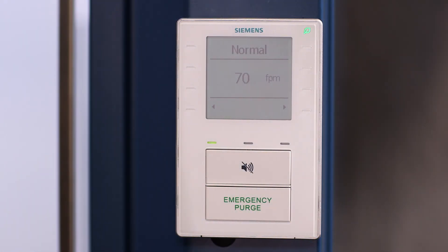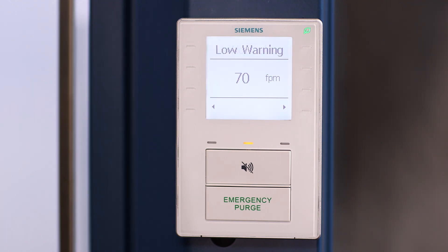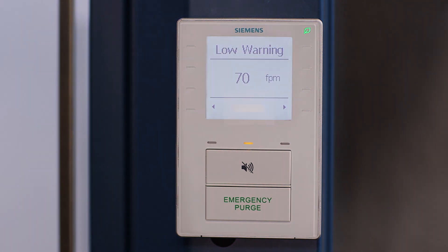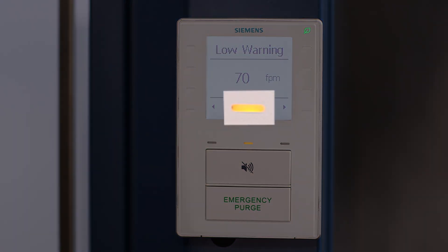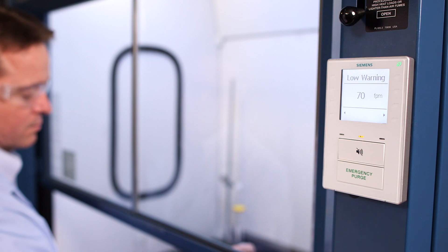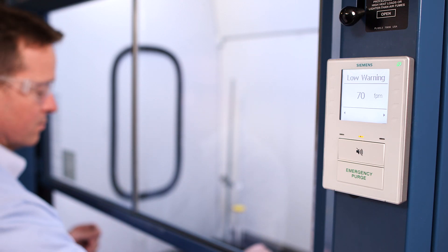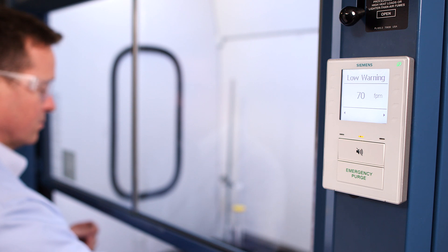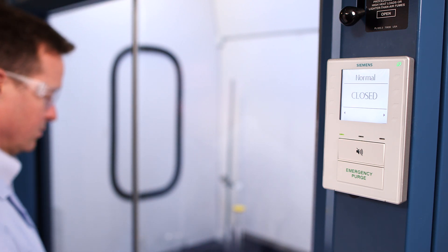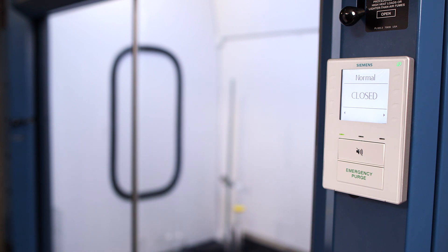Starting in normal mode, the system detects low exhaust flow and goes into warning mode, with the yellow indicator lighting and a screen message appearing. The lab tech sees the warning and should follow procedures established by their lab, addressing the issue before it becomes critical.